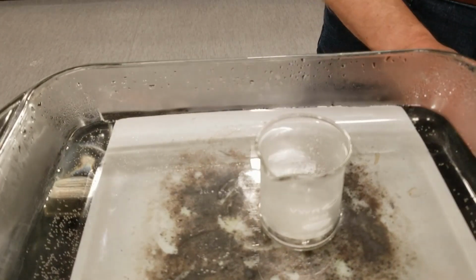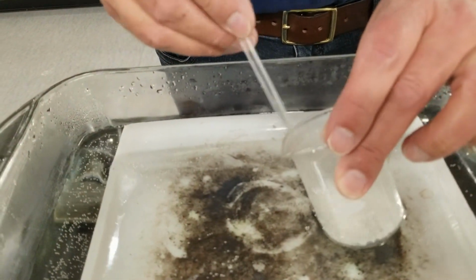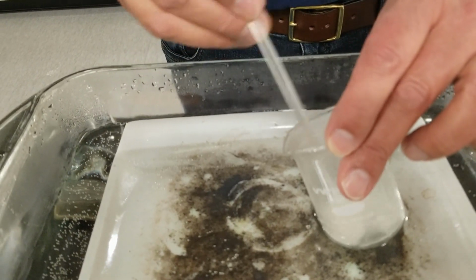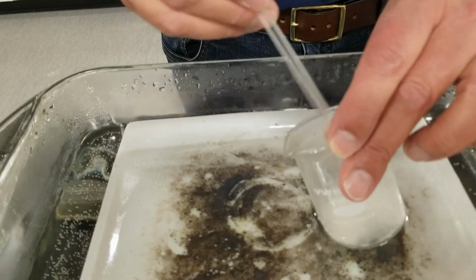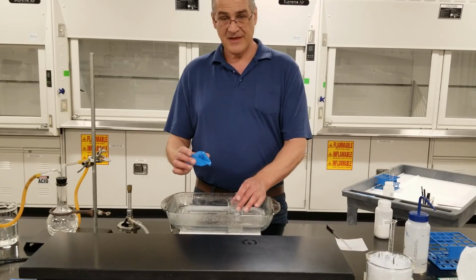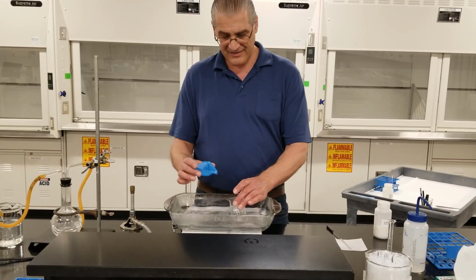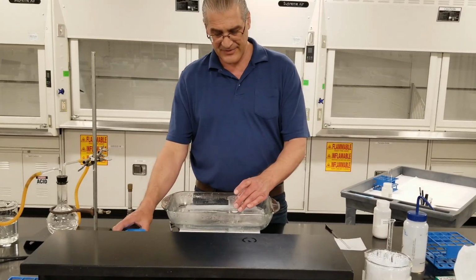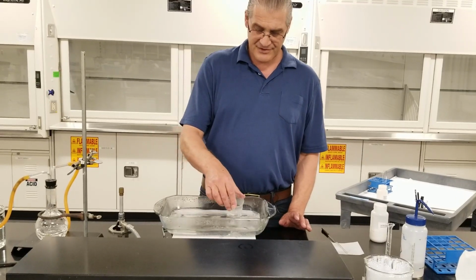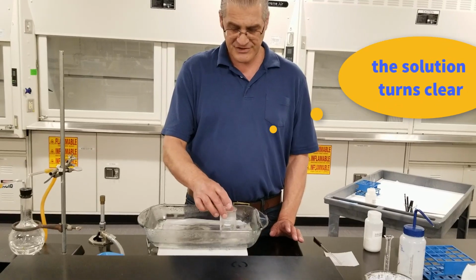It's a little bit tricky. You want to go kind of slow near the end, just little portions of the sodium carbonate, and hopefully you can get the solution to turn into a nice clear solution. And here I'm adding some more sodium carbonate, and that last little bit I added seems to have made the solution turn to a nice clear solution.